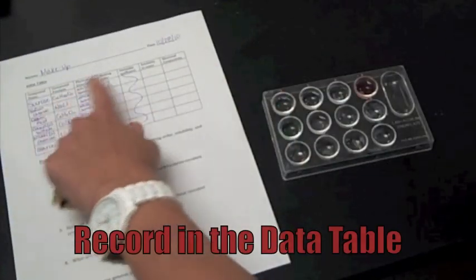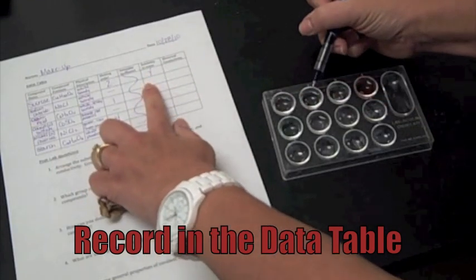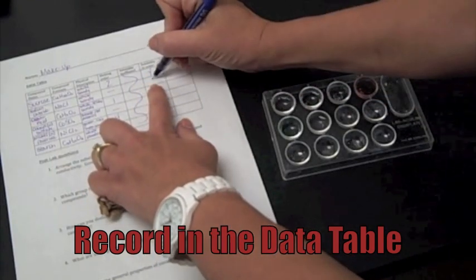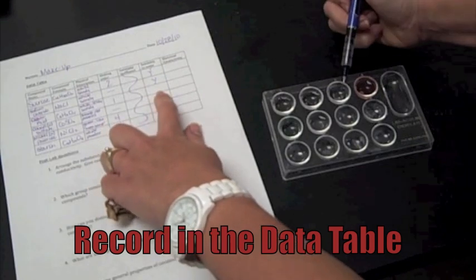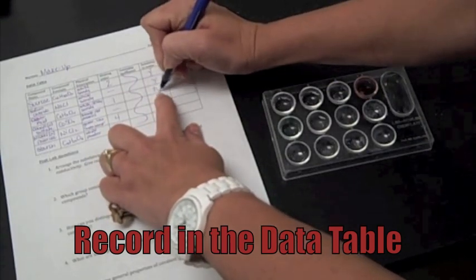So, the sucrose, yes, it dissolved. The salt, obviously, yes, it dissolved. The oxalic acid, I still have chunks of oxalic acid in here, so no, it did not dissolve.